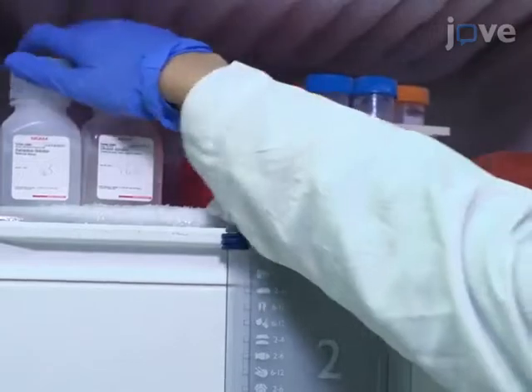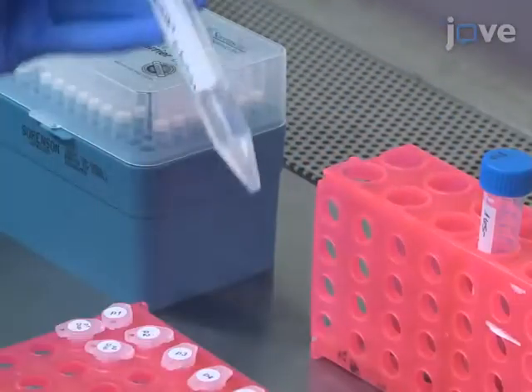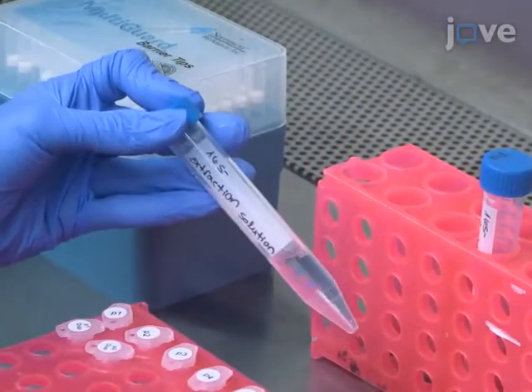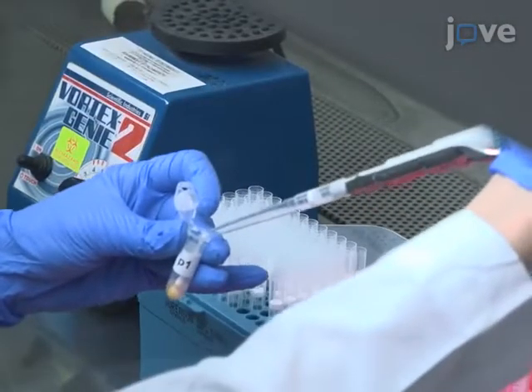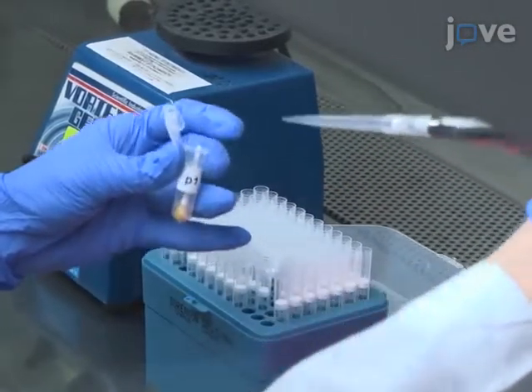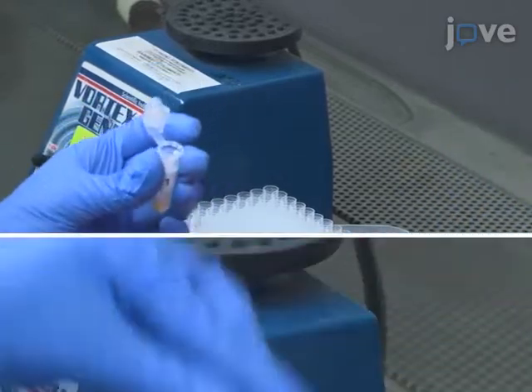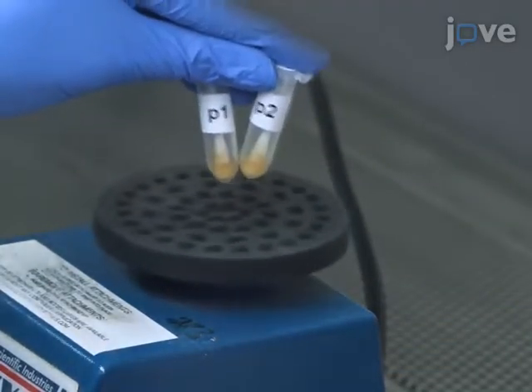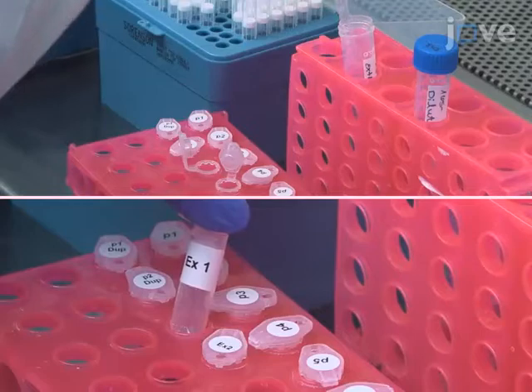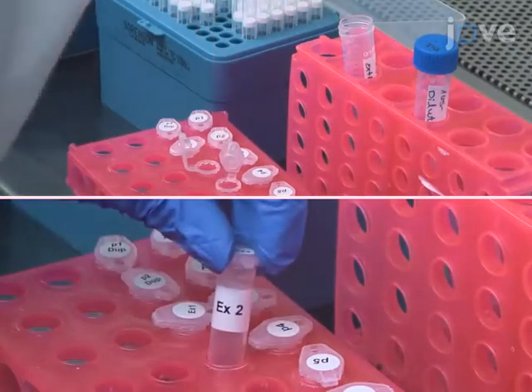Begin by thawing the extraction and dilution solutions at room temperature along with the fecal samples and control samples. Once thawed, add 250 µL of extraction solution to each sample tube and mix the feces into solution using a vortex. Introduce two buffer-only negative controls at this point.